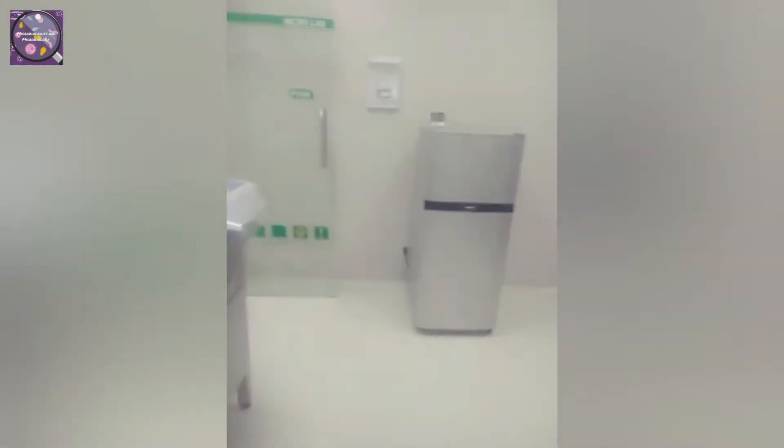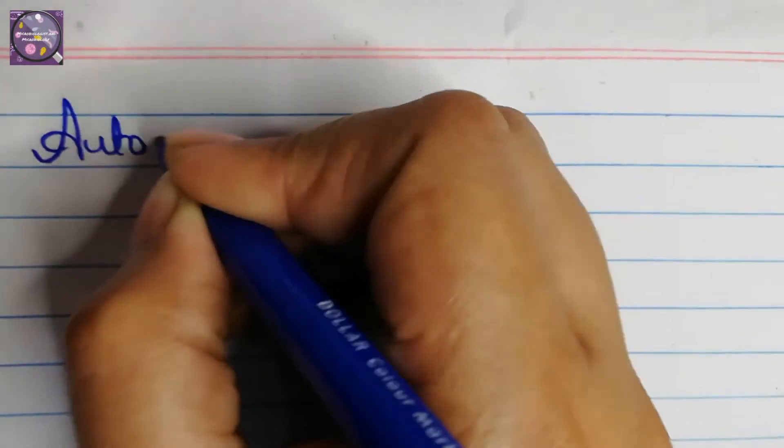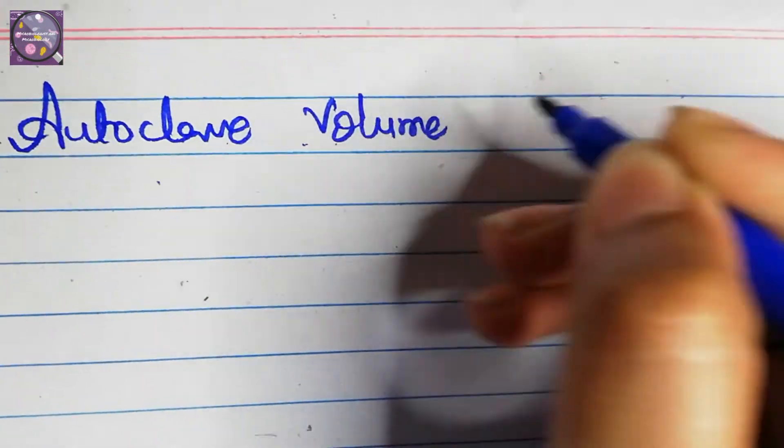When I was a fresher, I was surprised that why some microbiology equipment volume we say in liters — for example, incubators, autoclave, dry oven, etc. Like, I have a 10-liter incubator in my lab. So how can we measure the volume of an incubator or autoclave? Let's do this on the autoclave. For autoclave volume measurement, there is a formula for circumference from which we find the radius.